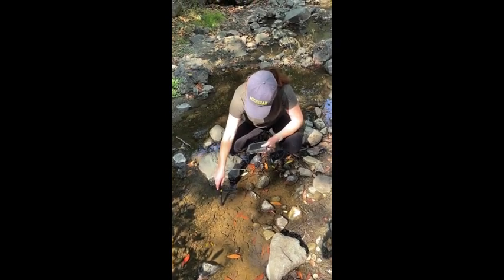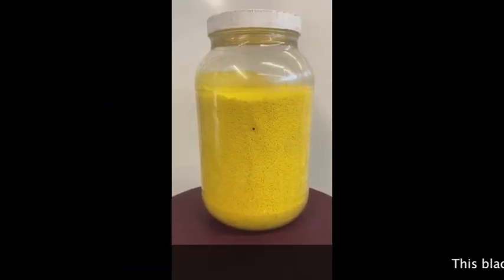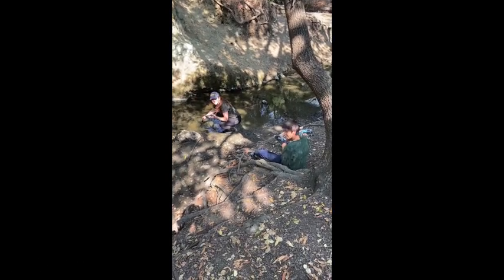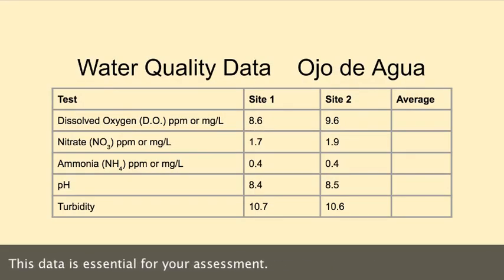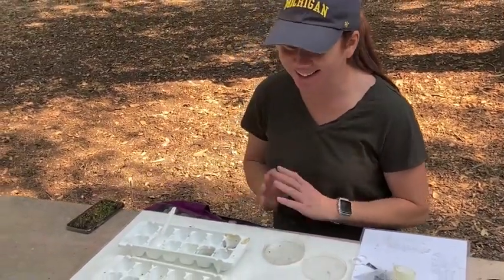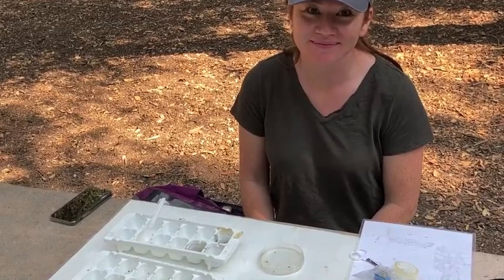So can you tell us what you're doing there, Ms. Wall? I am measuring the dissolved oxygen in parts per million using this probe, and I'm just waiting for it to level out. And there she goes recording nitrates, and our able-bodied assistant is taking the data. What are you doing there, Ms. Wall? I am videotaping the invertebrates that we found in the creek — we've organized them by type and we're just getting some close-ups. We just got done naming them all so we can keep track of who's who.